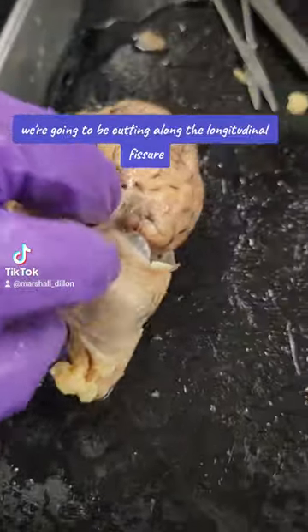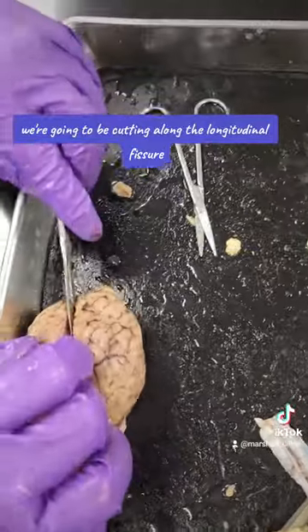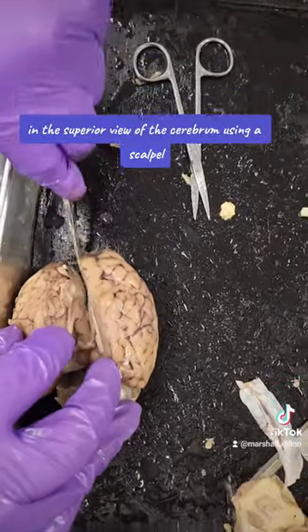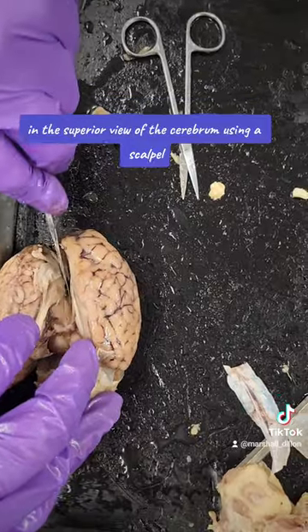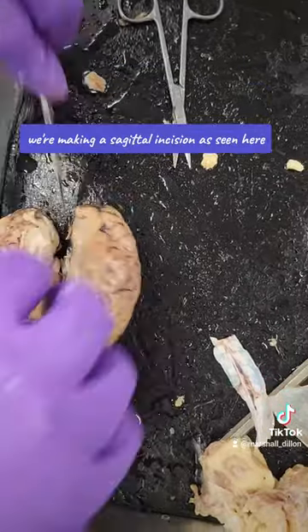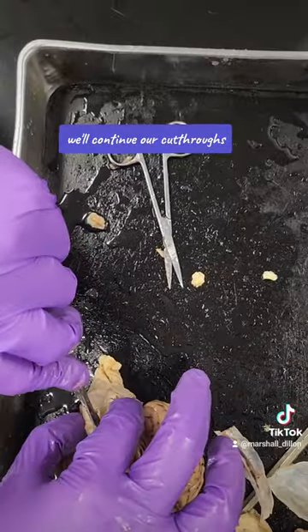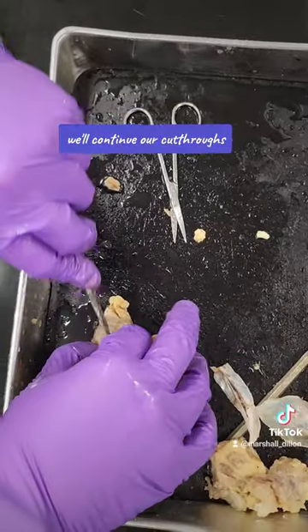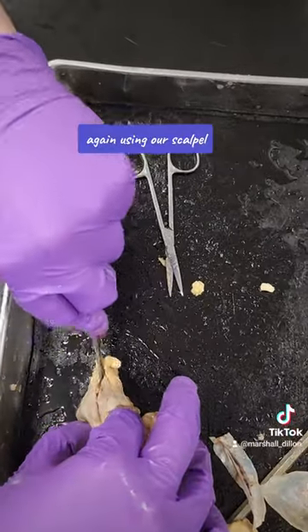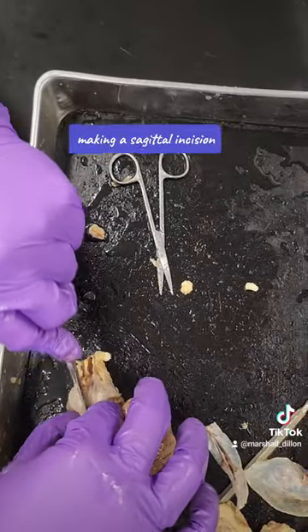We're going to be cutting along the longitudinal fissure in the superior view of the cerebrum using a scalpel. We're making a sagittal incision as seen here. We'll continue our cut through the cerebellum, again using our scalpel, making a sagittal incision.